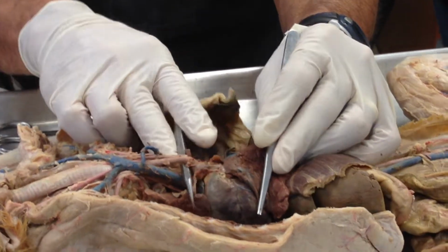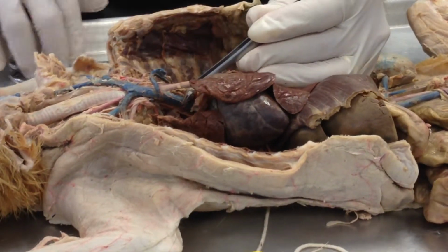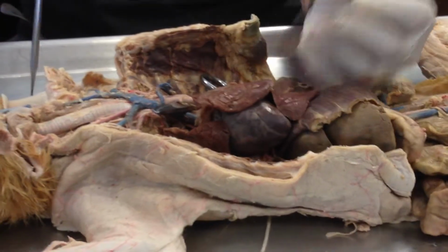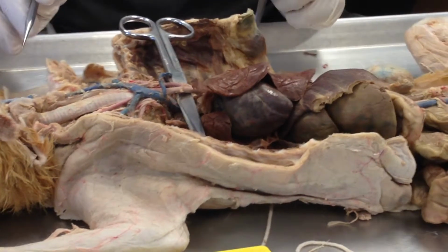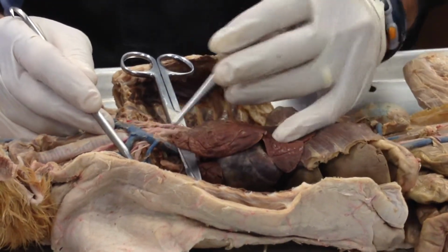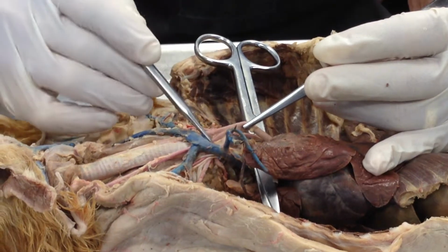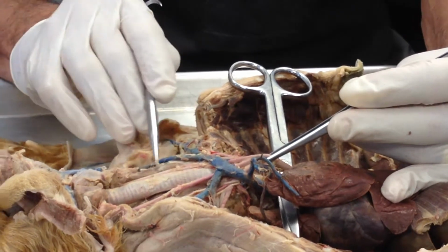Now the first branch right there is the brachiocephalic branch or artery. Again, notice here there's an artery and there's a vein. Okay? Then what we see is that my brachiocephalic artery will have three branches looping off of it, and here it's going to pull up aggressively like that so we can see the branches. 1, 2, 3.